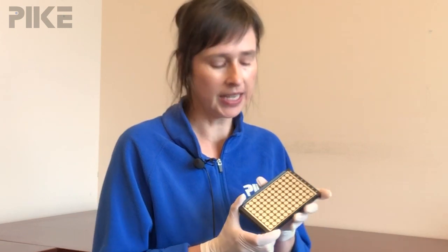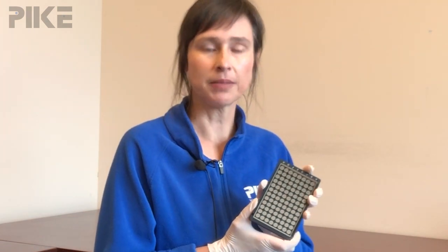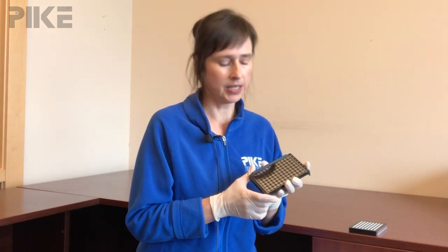For transmission measurements, the standard plate is a thin piece of silicon with a 96-well pattern masked onto it. How this is typically used is to deposit your liquid sample, let it dry, and then measure the residue.